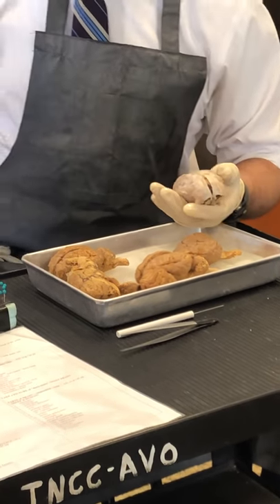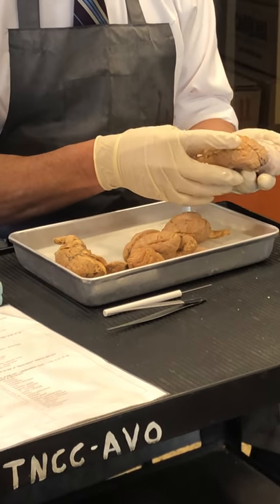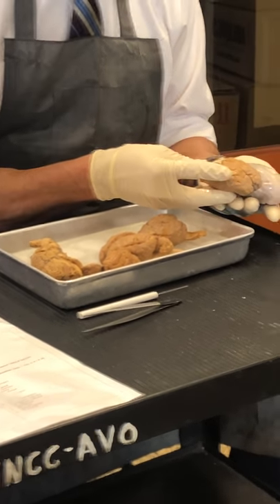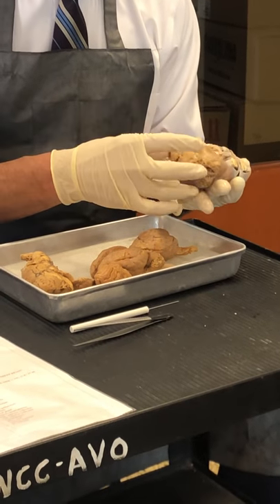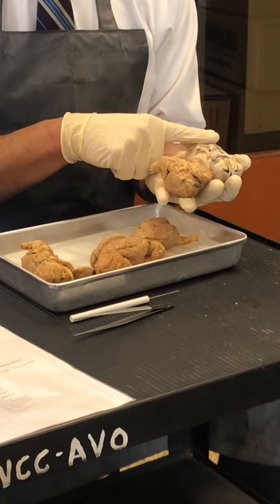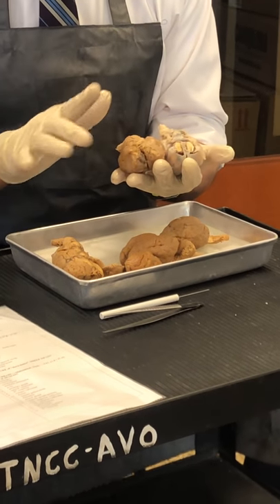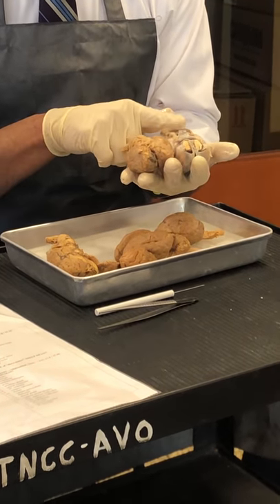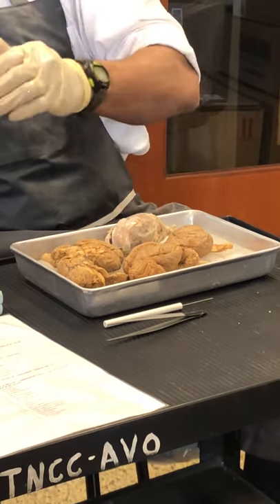Notice here — those diagrams right there are all like that. You can see the difference between them. So you want to make sure that today you are taking photos of this one especially as well. Okay, let's run through this all together here.